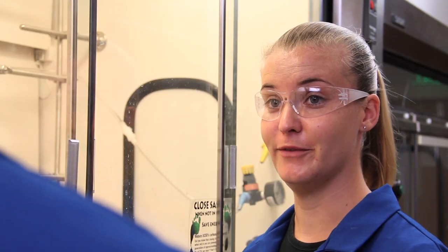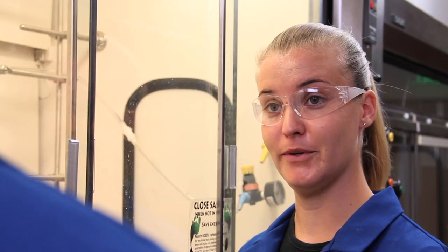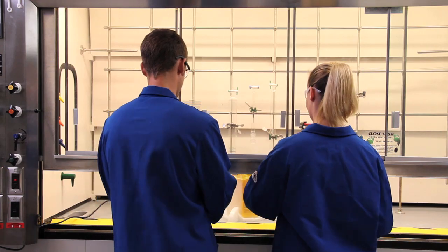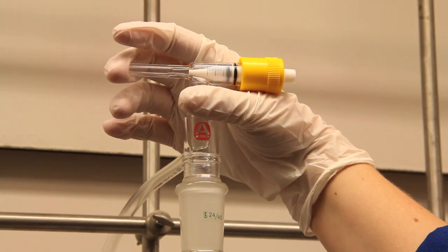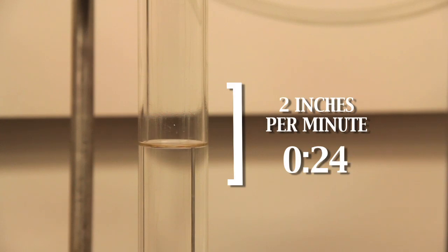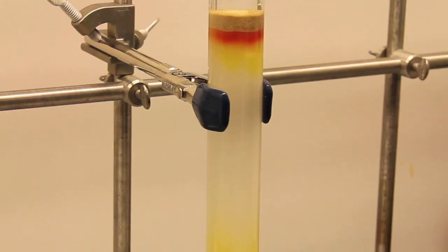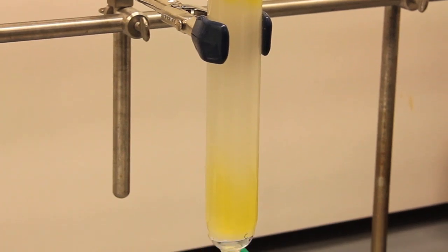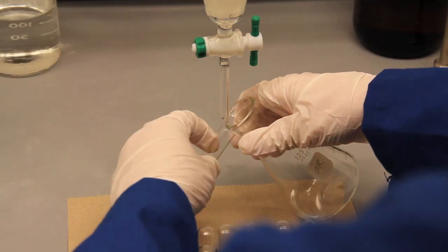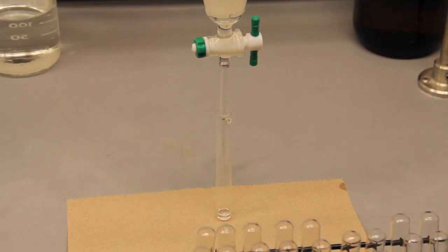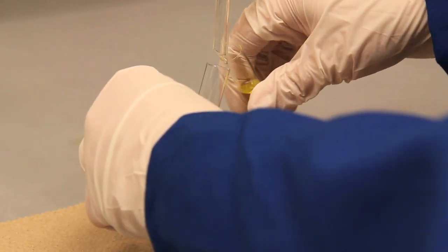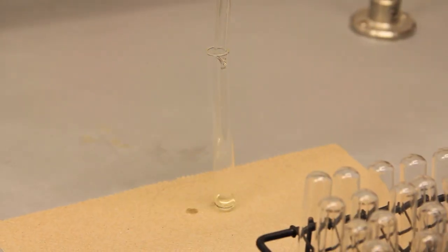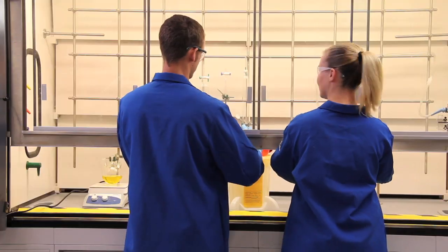Yeah, people that didn't read the paper believe that running the column slower actually gives them better separation. I like to collect fractions by hand, but others may move the whole tube rack. I'll show you what to do, but you'll find what works best for you. Every several fractions I run a TLC and then decide how to continue with the solvent gradient. Let me go run the TLC.